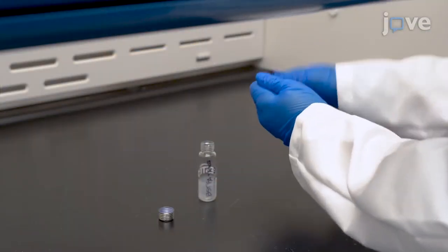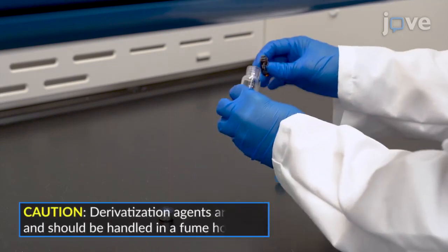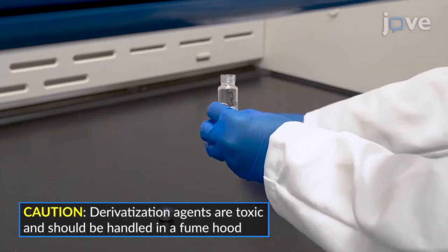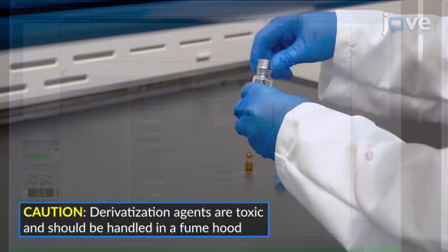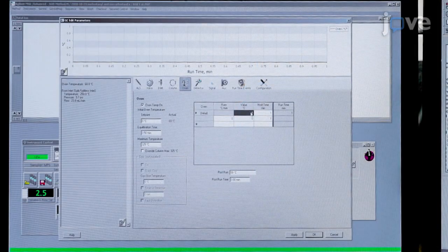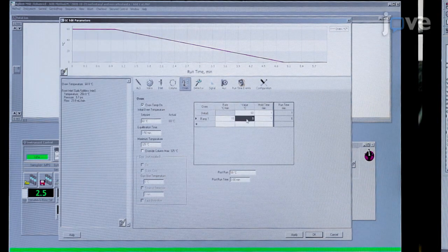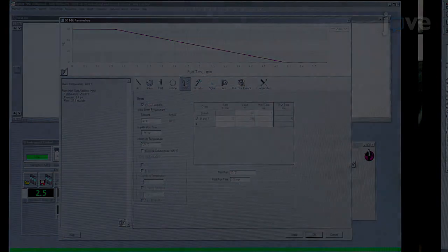If derivatizing the sample, prepare the proper derivatization agent by placing approximately 1 milliliter of the agent into a headspace vial. Set the proper incubation and extraction temperature, ensuring total vaporization, sufficient sample extraction, and complete derivatization.